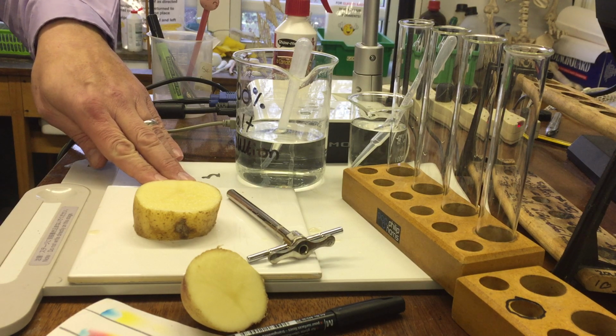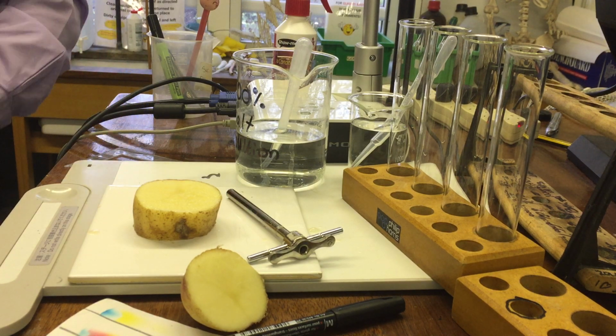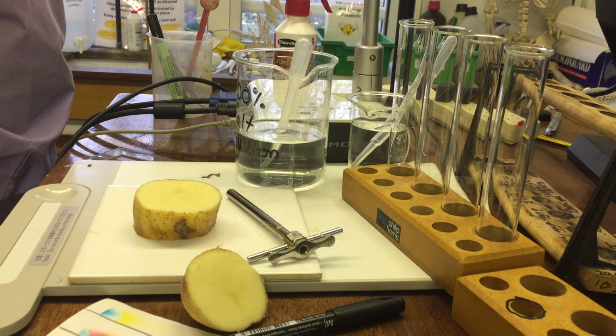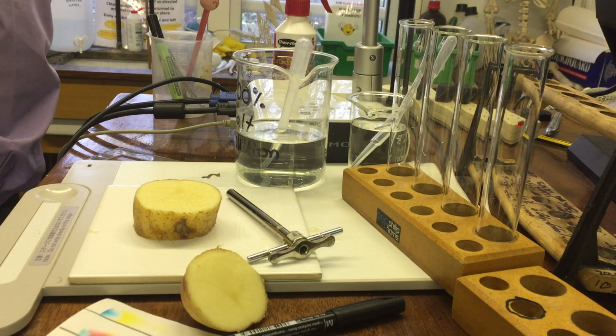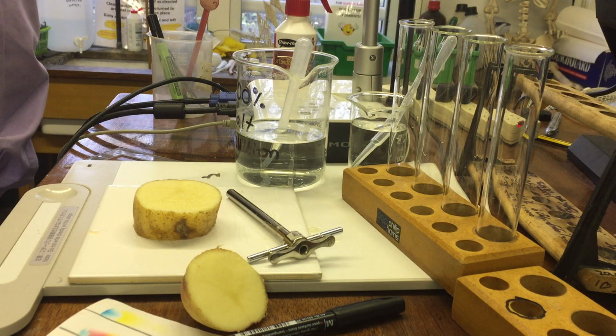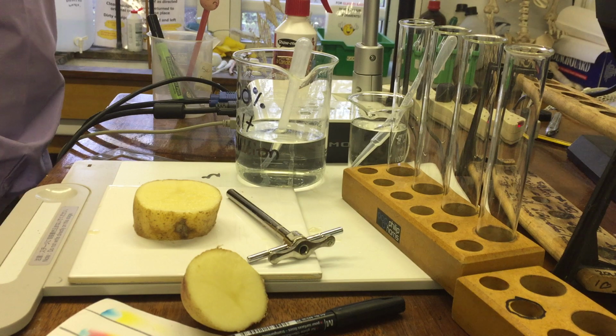Think of another controlled variable, something else you're going to keep constant. You're going to keep the same potato. We're going to use the same variety of potato. That could be a bit important. And you're all going to take your chips from the same potato. Anything else? So we're all going to come and collect our results at break. So what's going to be the same for the time that they're in there? It's going to be the time, isn't it? Okay. So the time's going to be the same.